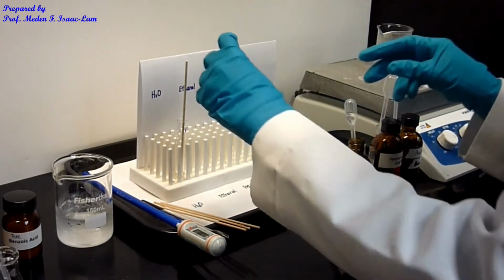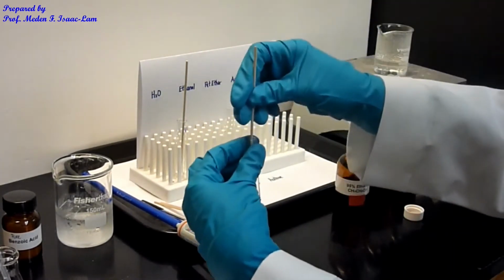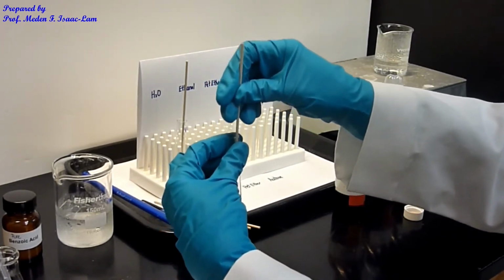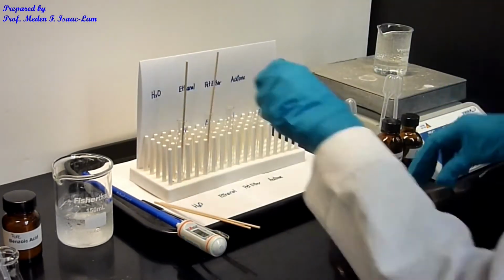That's E, and then I put in a boiling stick and try to crush it.